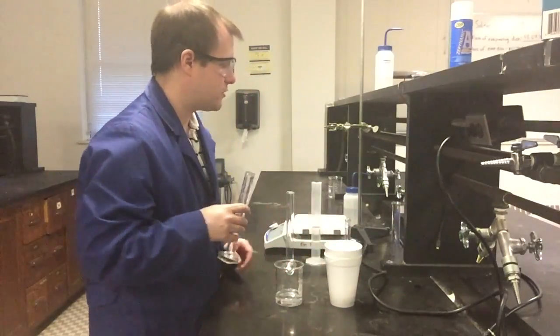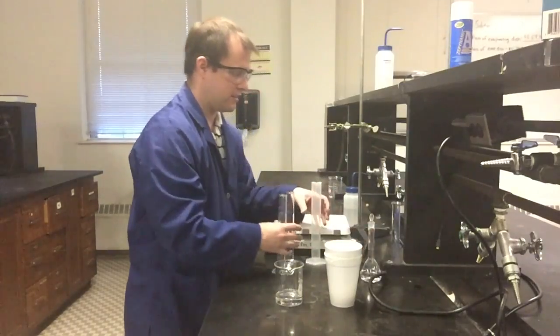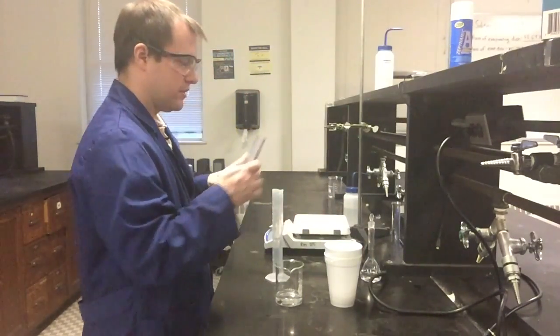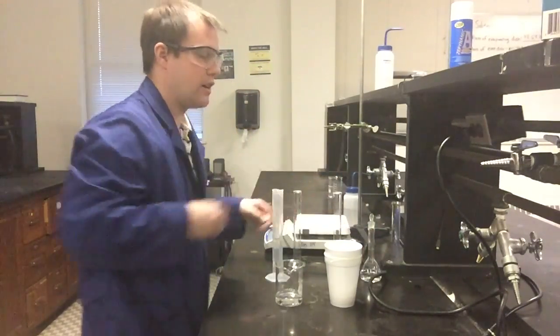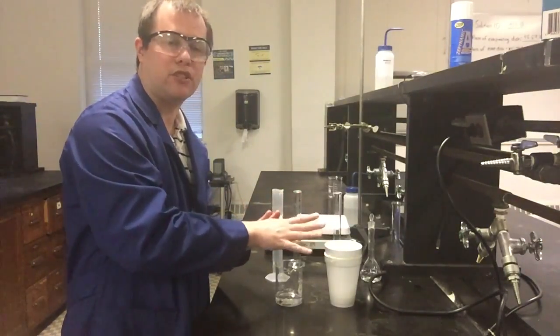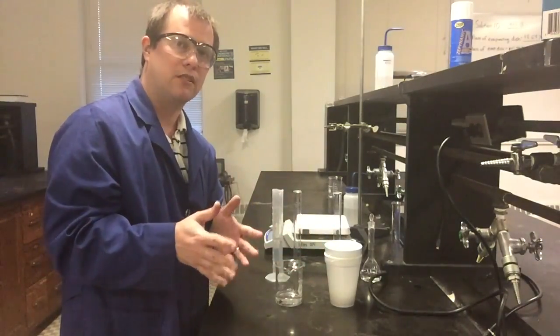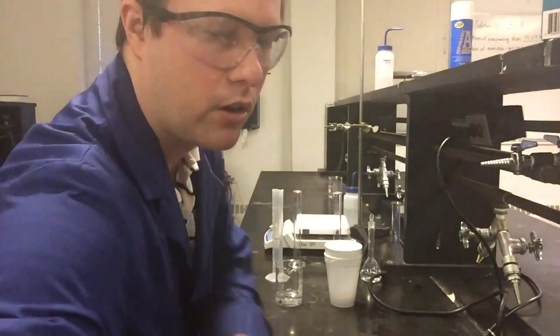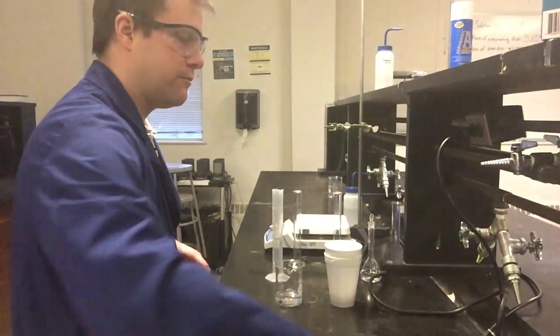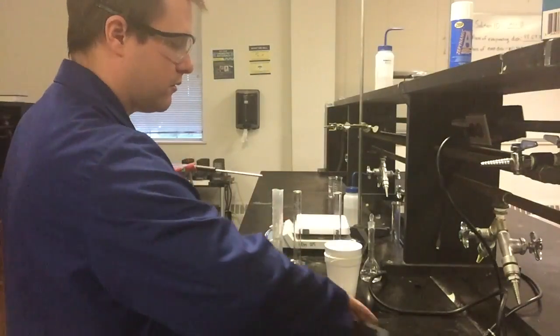And now what I actually want to do with all of this, I'm going to keep my acid and my base here, and the ones that I just used for each, all organized. And what I'm going to do is measure the temperature of each of these just on their own, sitting here, now that I've made the solutions, for about 5 minutes. And then I'm going to mix them, kind of the same thing I've done before. So I'm going to go grab my LabQuest again here, and get my LabQuest set up to record this information for me.